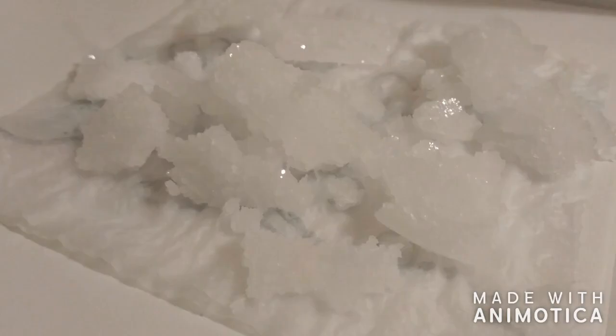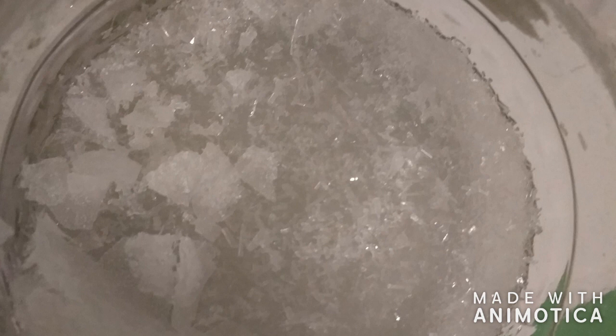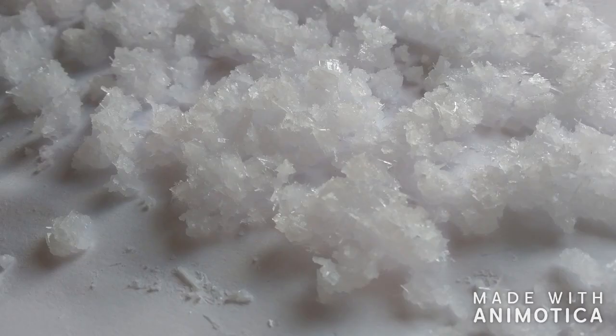After the recrystallization, I was left with a clump, like we can see. And yes, I was able to smell the decomposition of urea which made ammonia gas not very fun.